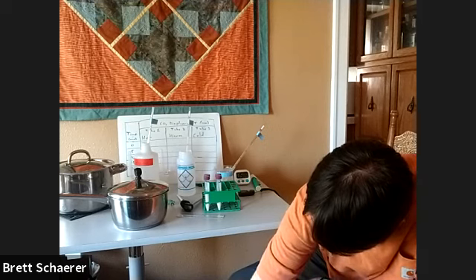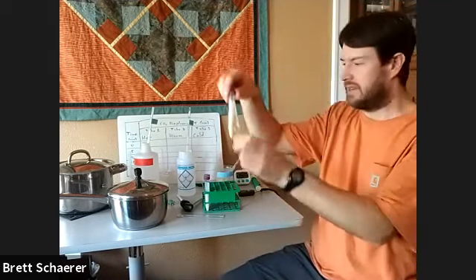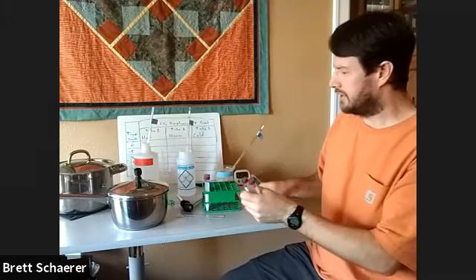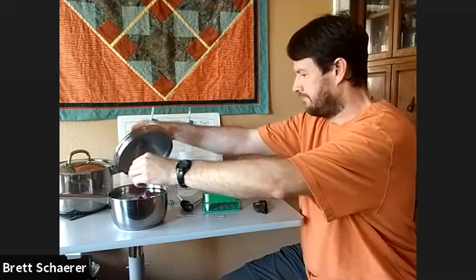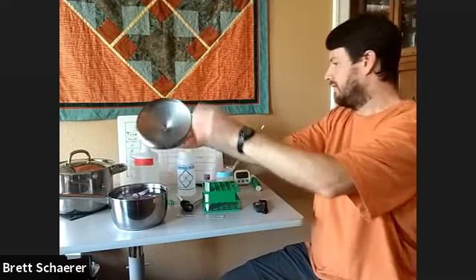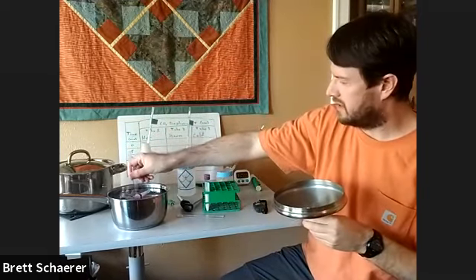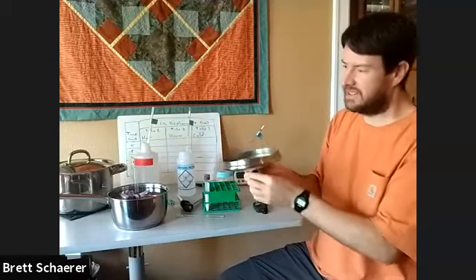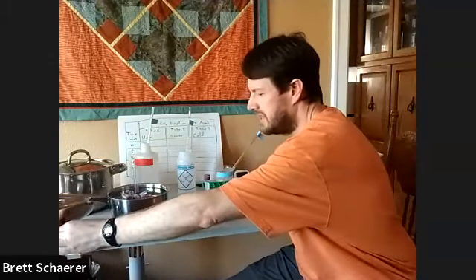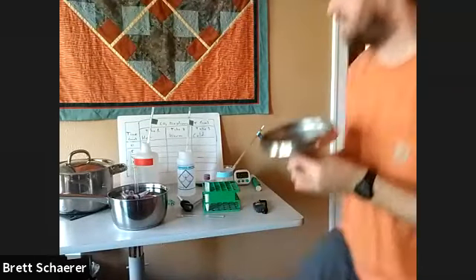Looks like I might have slightly too much water in that environment. Okay, these are going to go into the warm water. So that's this pot right here. Those will float, but that's okay. And we'll put the fermentation tube in there as well. I can't get the lid on this, but it's not that much different from room temperature, so I think we'll be okay on that one.